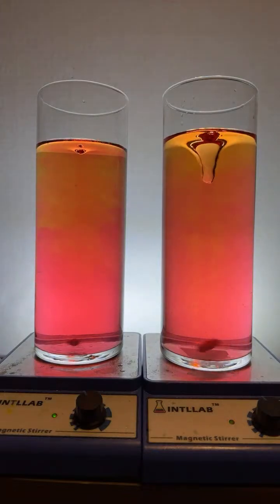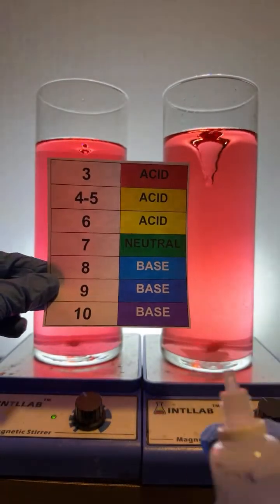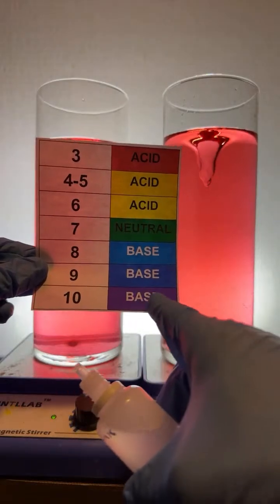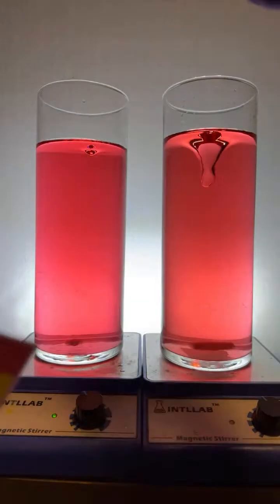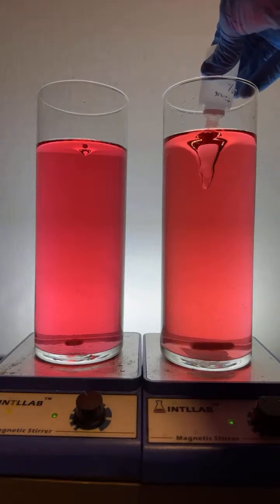Why is there a purple stripe on the left container? Here, let me show you. Let's do the purple stripe, okay? Here we go, IP. Notice these are both red, so the pH is very low. I'm now going to add base, and the base is pH 10. That's going to look violet. Just like this vortex here, I'm adding the base.